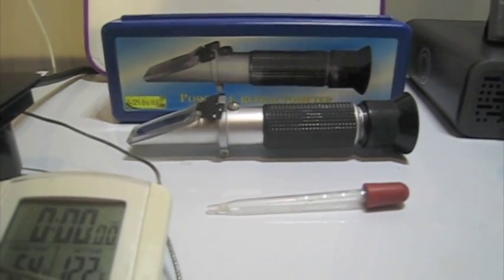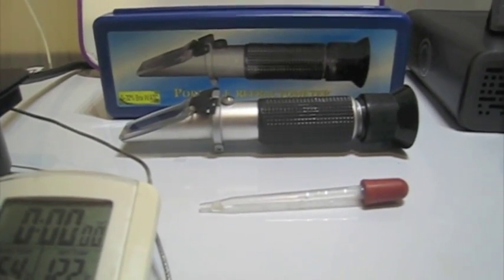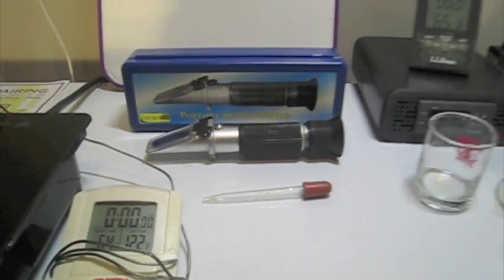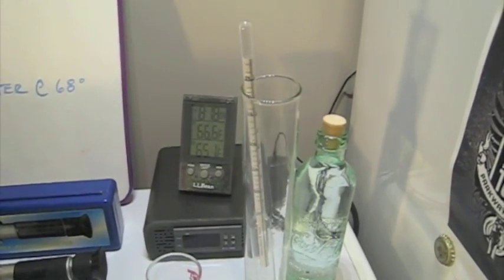I have our refractometer, which is pretty typical of the refractometer that I think all of us use. Over here, my hydrometer, as well as a sampling vessel.